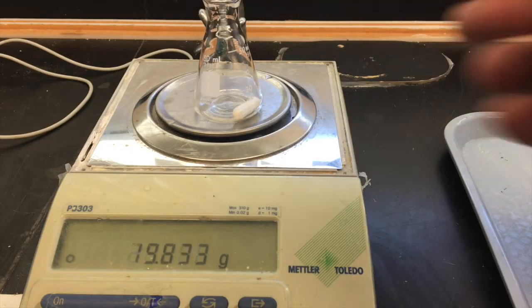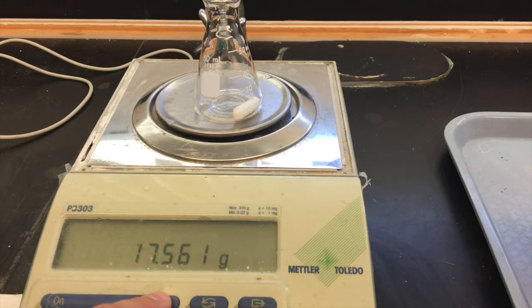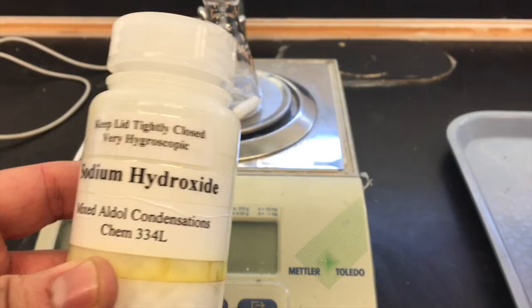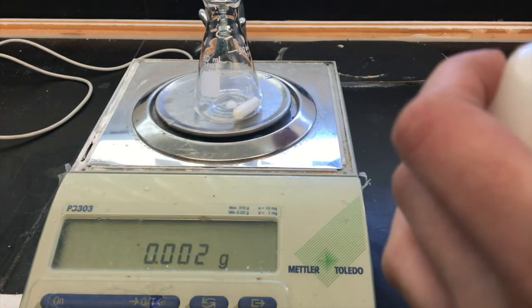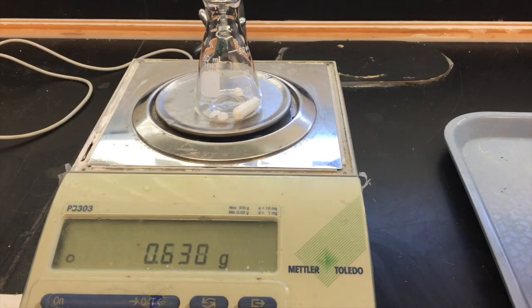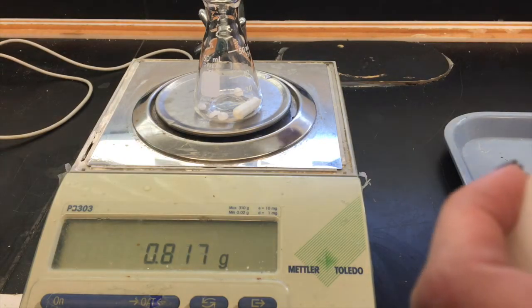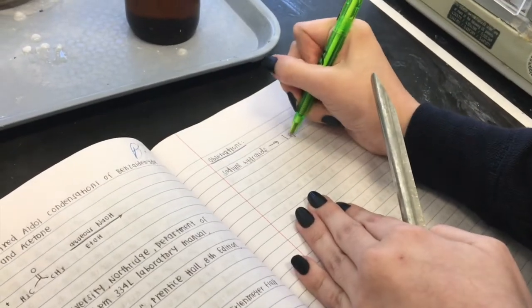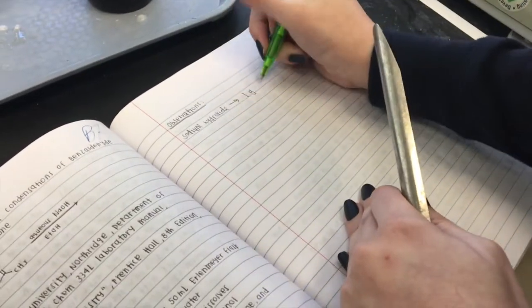Starting with A, today you're making your own sodium hydroxide solution. Sodium hydroxide is hygroscopic, so it absorbs water from the air. This means that you don't want to leave the bottle open even if there's someone standing right behind you waiting to use it. And when you inevitably spill some on the counter, you want to pick it up as quickly as you can rather than leaving it there to melt into a very concentrated basic puddle. Remember to record the exact amount that you used. Wait, you're missing some sig figs there. Thank you.